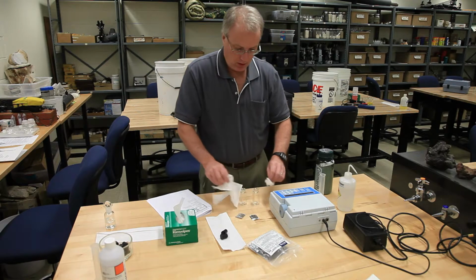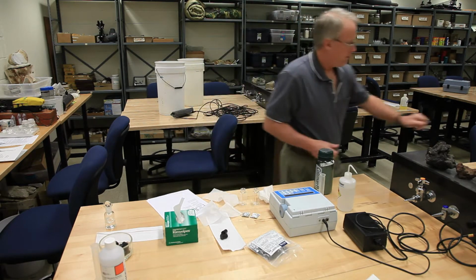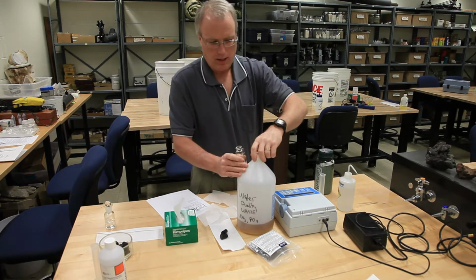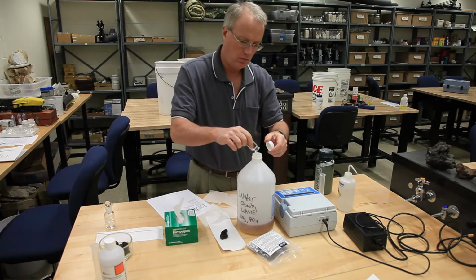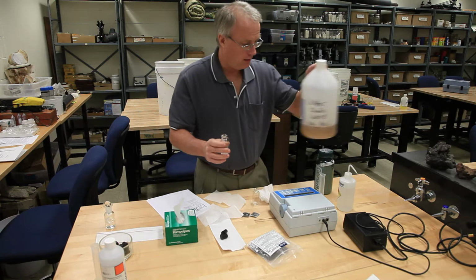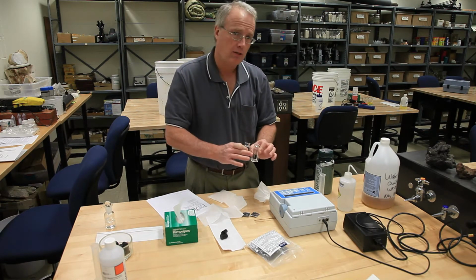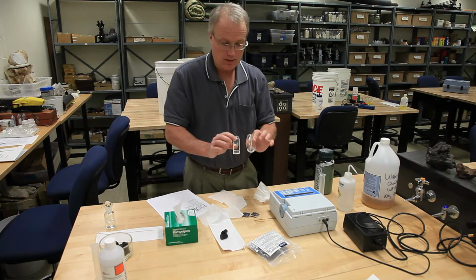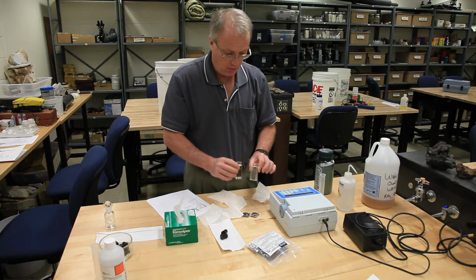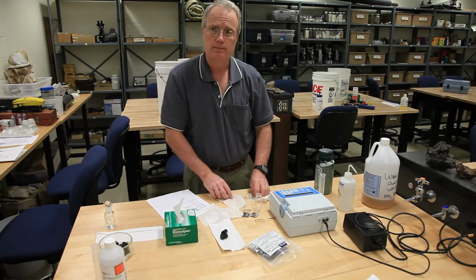And as with all the tests where you use any of these powder pillows, the leftover water from the test needs to go into the waste jar. And then these need to be cleaned really carefully and thoroughly with test tube brushes, because those chemicals will coat the glass on the inside and ruin these. And these are about $60 a piece, so before you put them away, make sure that they are well washed.